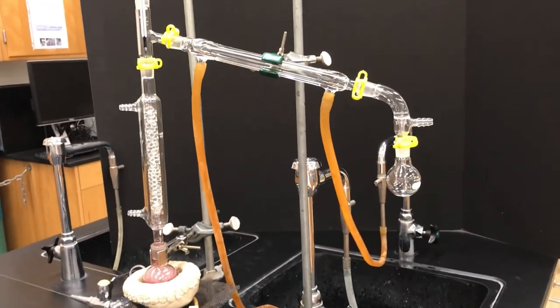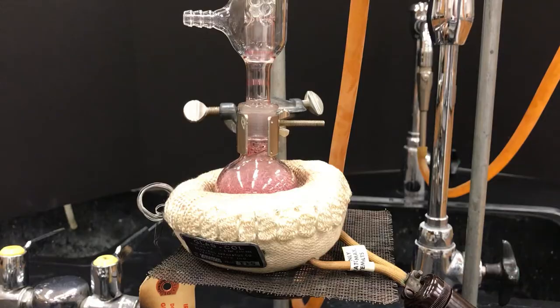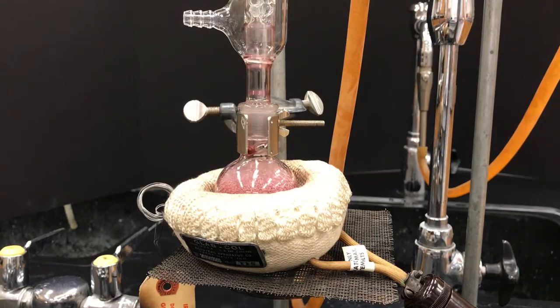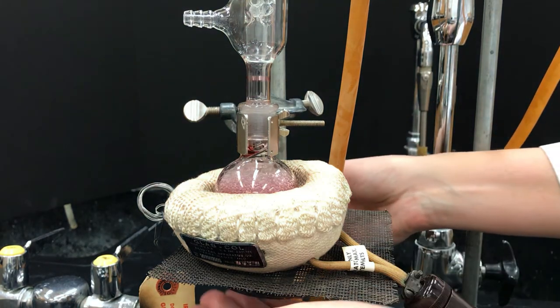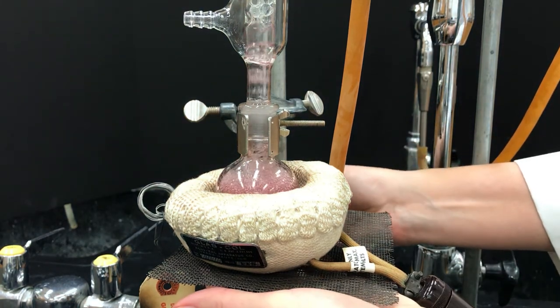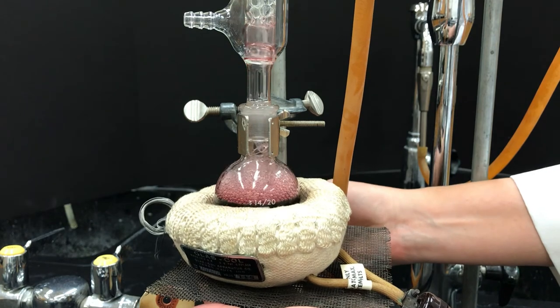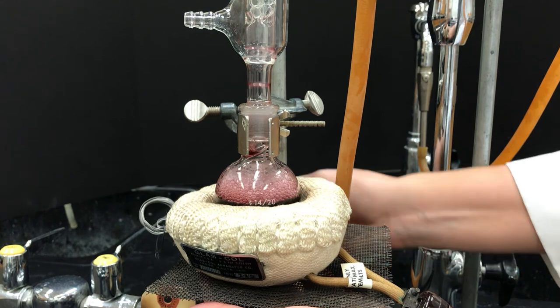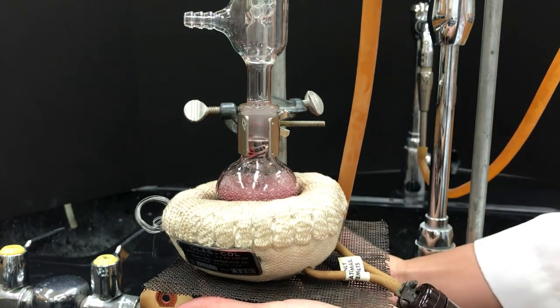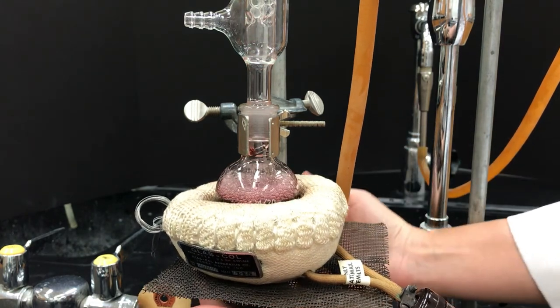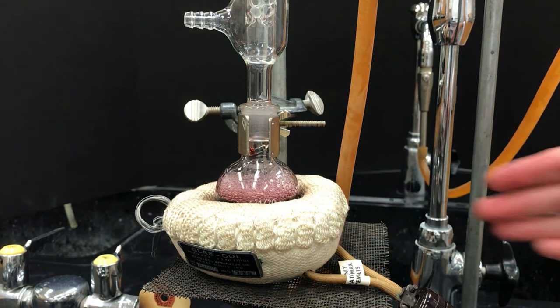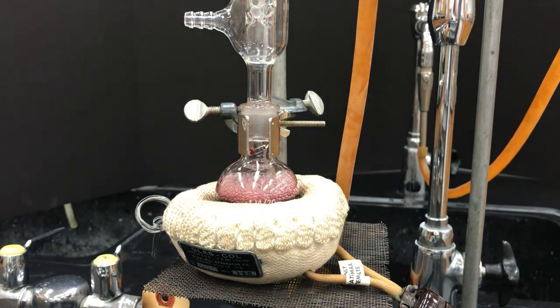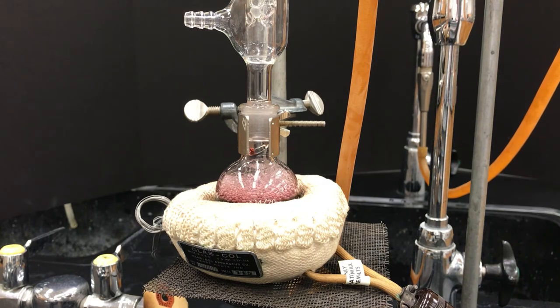And when I stepped back I noticed, oh shoot, look what's happening to the liquid. So sometimes, especially if you overfill the flask like I might have filled it a little bit too much, you'll get it spitting up a little bit like that. So if that happens you haven't ruined it. Just take your heating mantle and lower it and reduce the heat somewhat to try to calm it down. But it really isn't a disaster if you do have that because the liquid is not going into the distillate, so it's still salvageable.